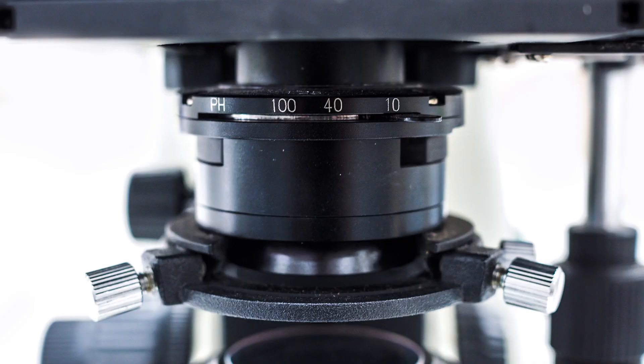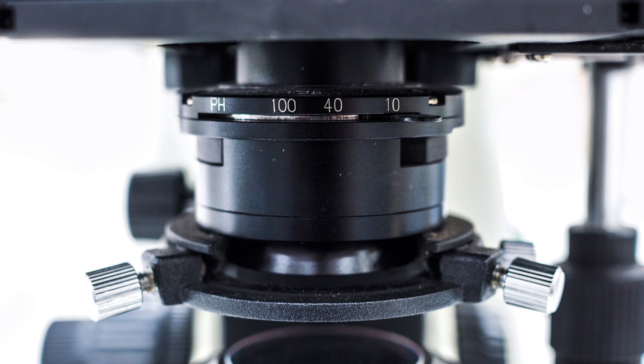Remember that when using magnification 10x or higher, do not forget to adjust the diaphragm lever to the right.